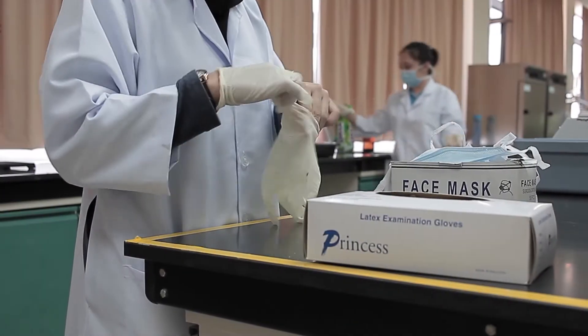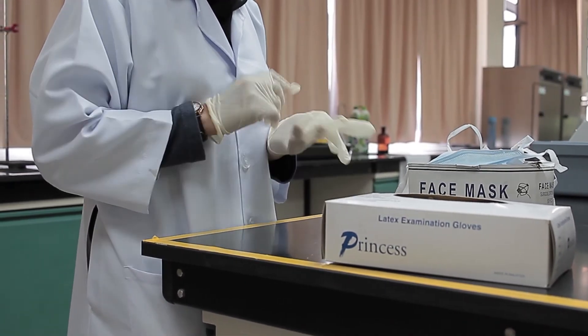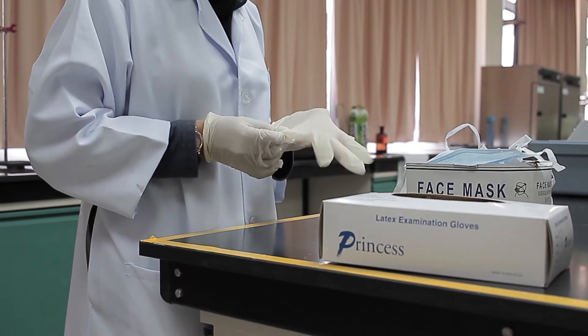Before starting any test, we must wear hand gloves and face mask because we will be handling reactive chemicals.